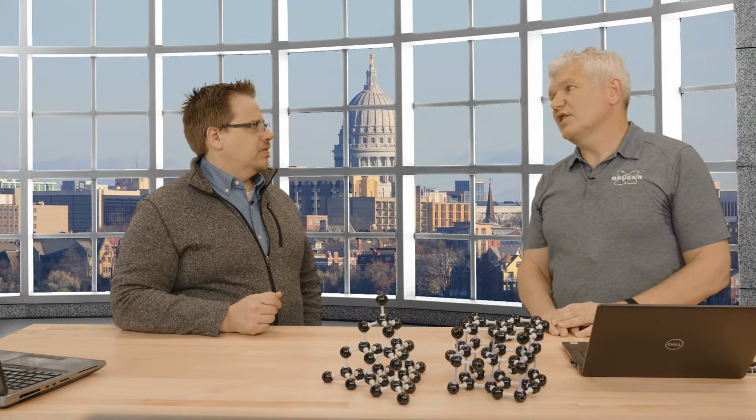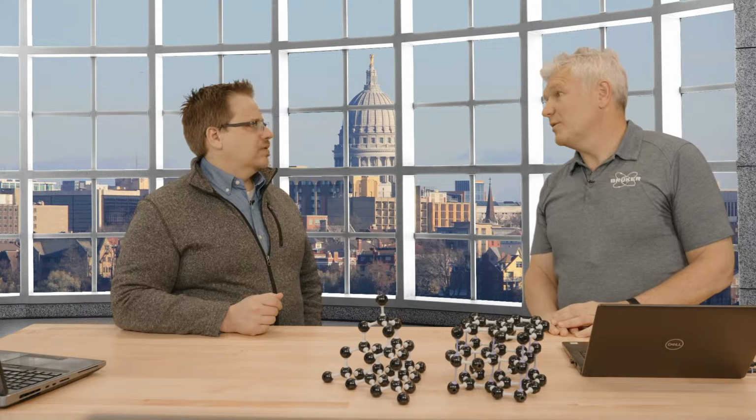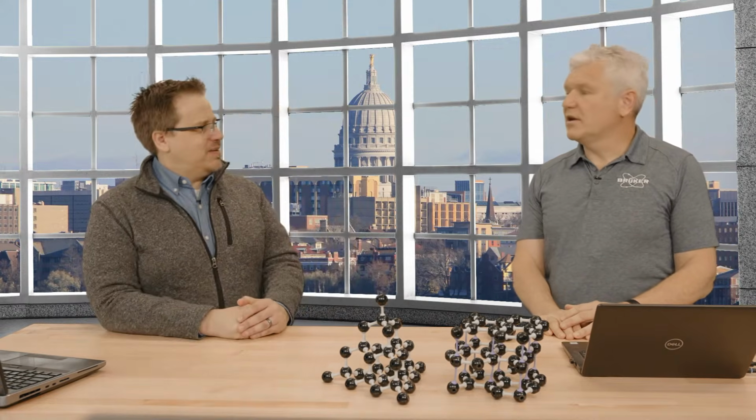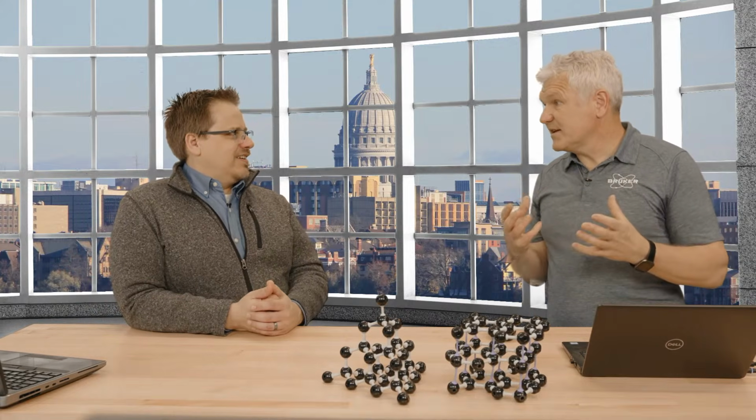Yeah. Then there are, of course, more steps, and maybe we could talk later if you invite me again. Yeah, definitely. Another episode of Live from the Lab. Determine the intensities, and also deconvolute the intensities when you have overlaps. And you need that to be able to solve and refine the structure.